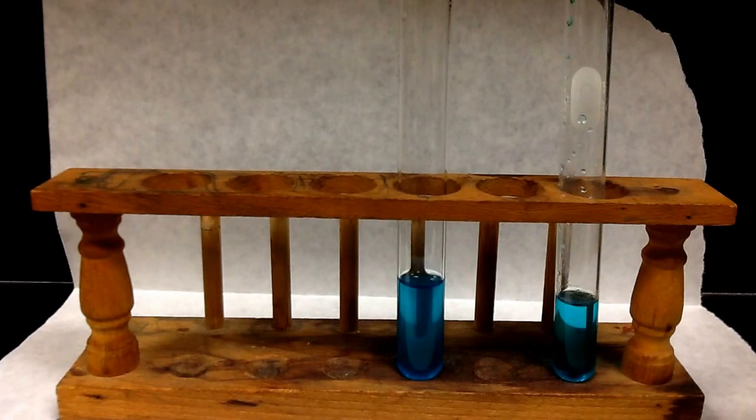Alright everybody, this is going to be a reaction with a copper chloride solution and aluminum metal.